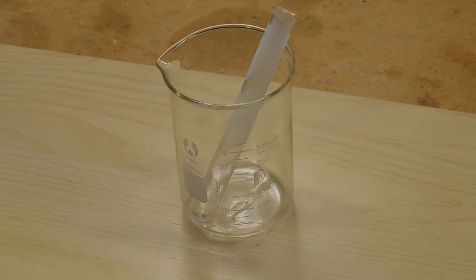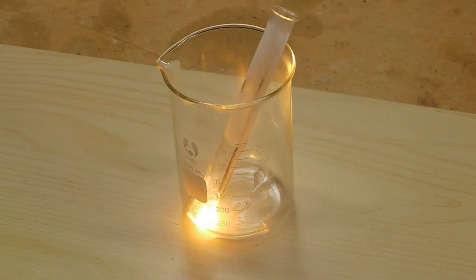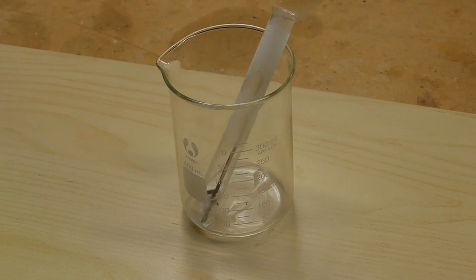There's our tube of boiling nitrous oxide. To see if it supports combustion, I'm going to put a burning piece of wood in there, and sure enough, it does help combustion.